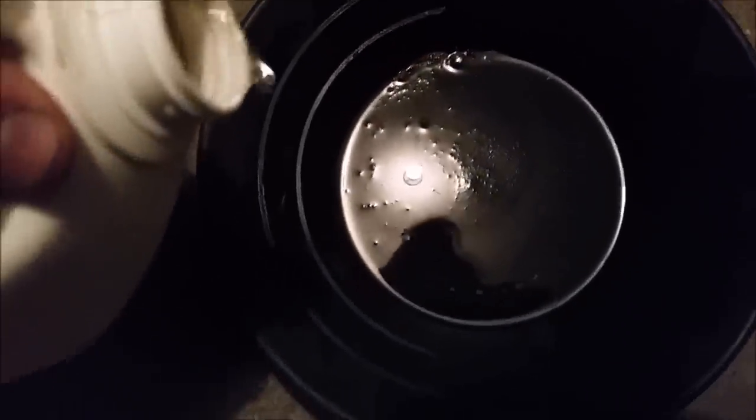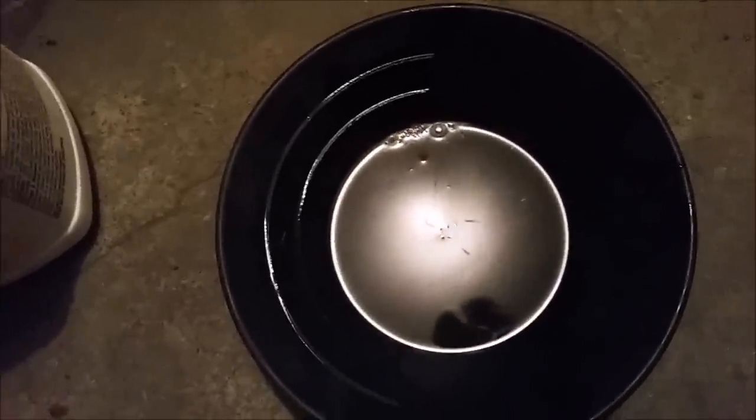There's a little bit of dirt and the mercury doesn't seem to want to collect into a single ball, so I'll have to clean it. I have here some muriatic acid, which is hydrogen chloride dissolved in water. I'm going to add a small amount to the pan to clean the mercury droplets. Hydrochloric acid itself will not dissolve the mercury, but it will dissolve most everything else, allowing the mercury to be clean enough to stick together. The cleaned mercury should then gobble up all the little droplets into one big mercury bead.